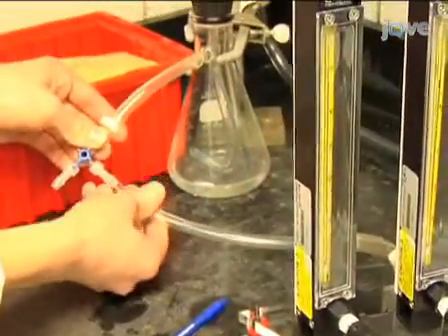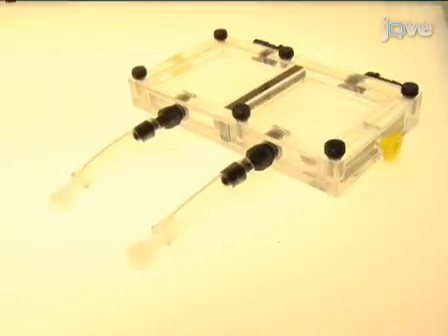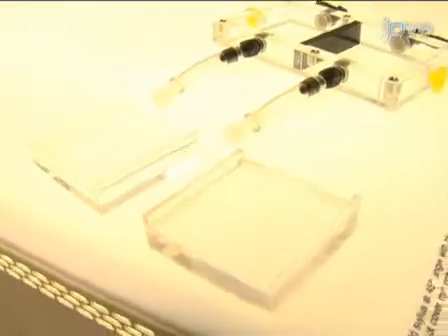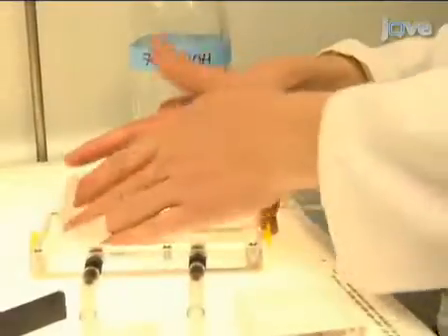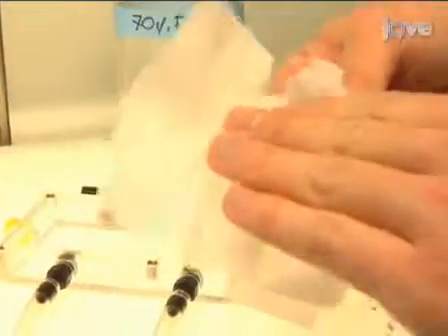One branch of the Y valve connects to a flow meter, while the other branch connects to the square locomotion chamber. This square locomotion chamber is based on the design from Wolf et al. 2002, with the addition of small drop trays to prevent the flies from flying within the chamber. Before connecting the chamber to the tracking system, remember to use 70% ethanol to sterilize all the chamber components. Allow the components to dry before use.